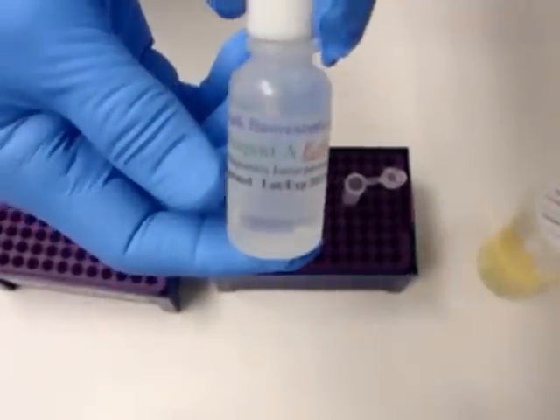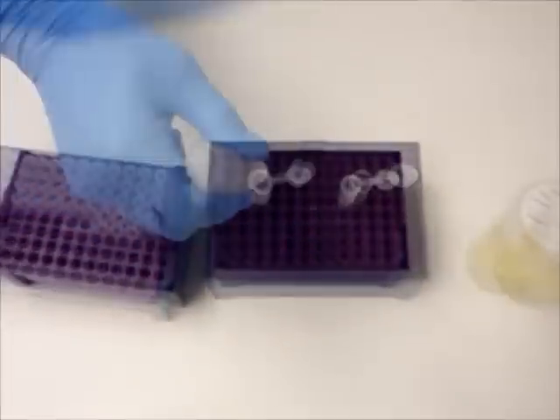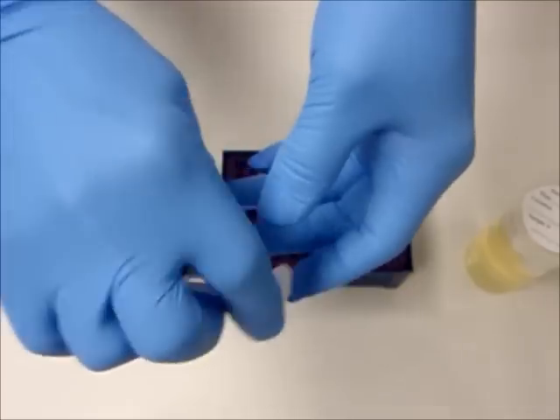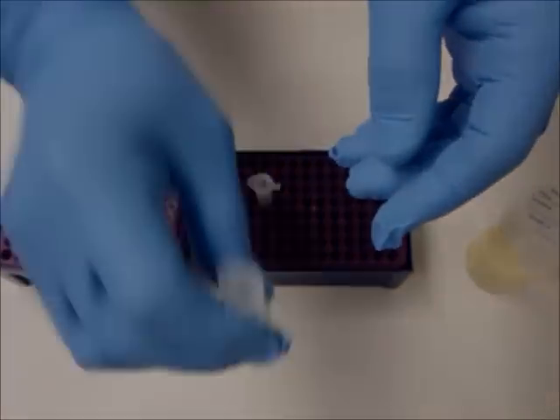After 10 minutes, add 2 drops of Reagent A to each plastic mixing vial. Secure the cap and gently shake to mix the solutions. Incubate both mixing vials at the designated temperature for 20 minutes.